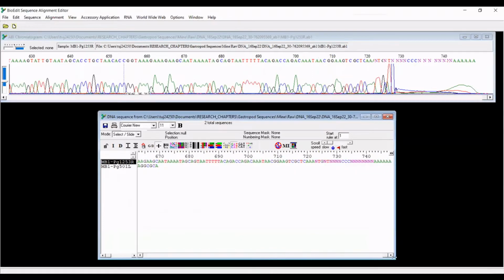But just like before, you want to start at the end and trim the sequences. So I can already see that we've got some repeats of triple A's here. And so I'm not super thrilled about how all of this from here on out looks. Yeah, so I think, again, this is your call, and this is not make or break. It's always best to keep more than less. And so after these 3 A's at position 661, right here, I am going to delete the remainder of this sequence.